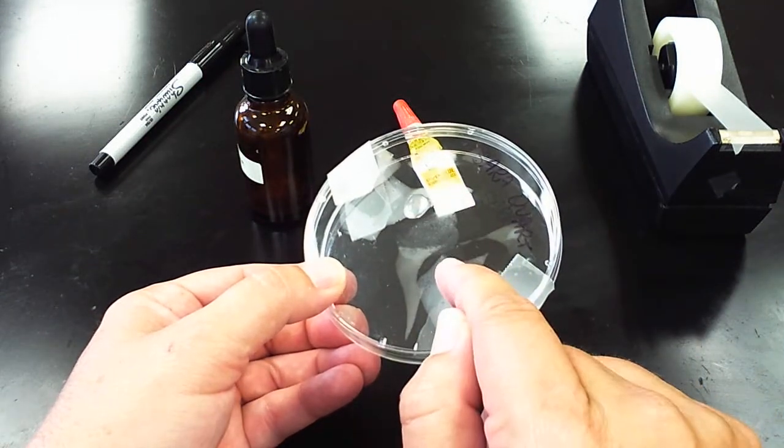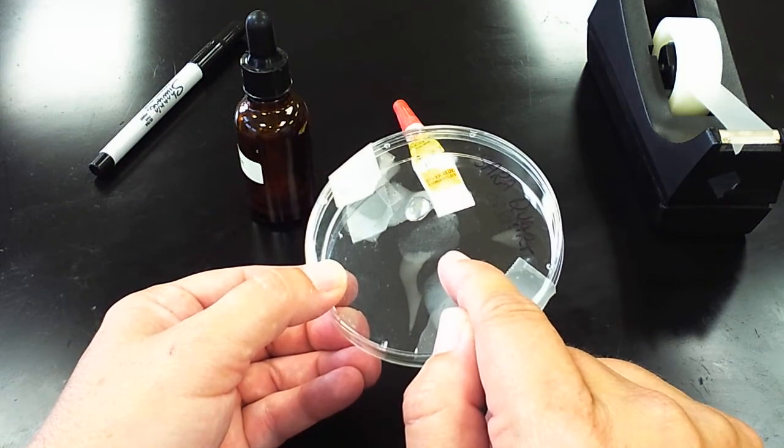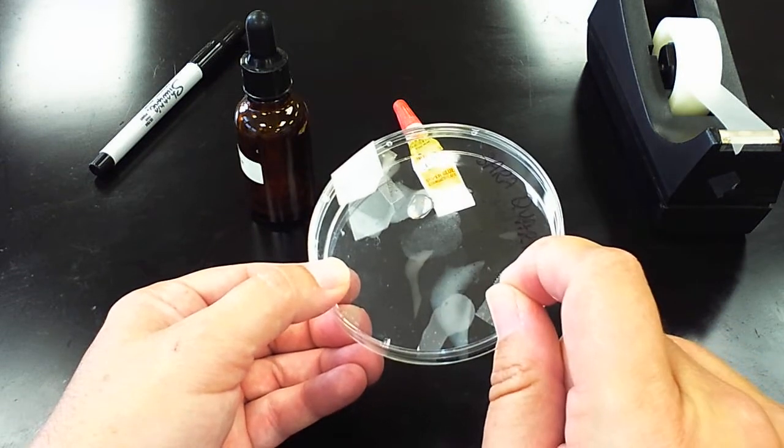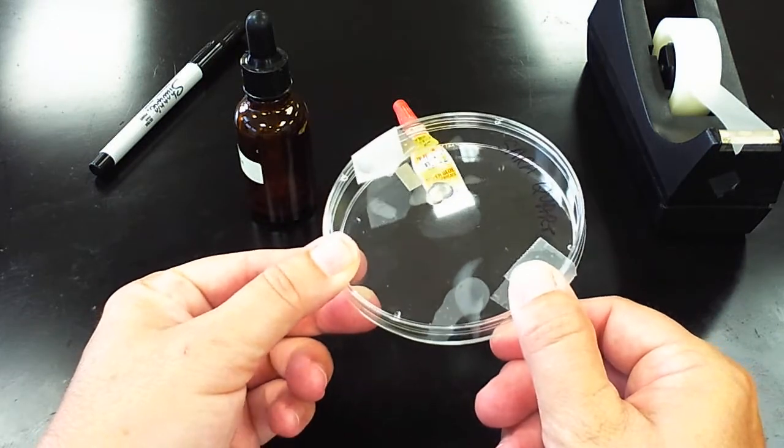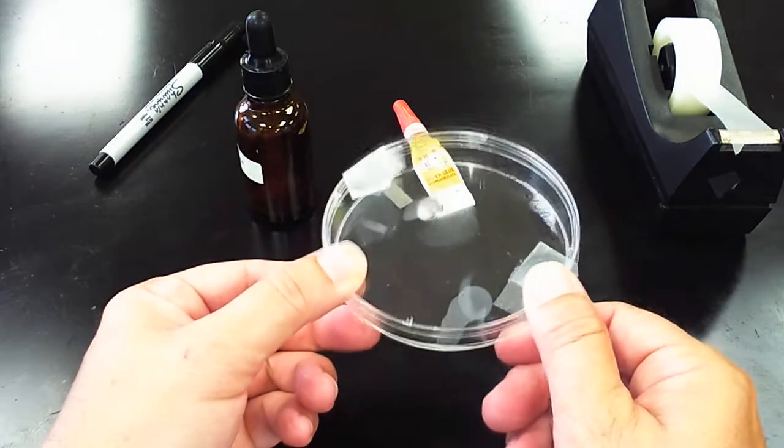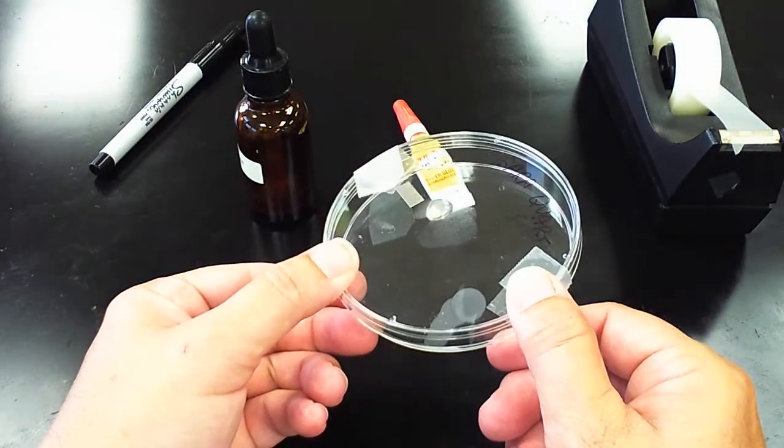Once you have that, I want you to come show me your fingerprint on your petri dish. I'm going to sign off on your lab that you completed this activity, and then you are free to take this petri dish home. You can show somebody at home how cool it is to lift the fingerprints with super glue.